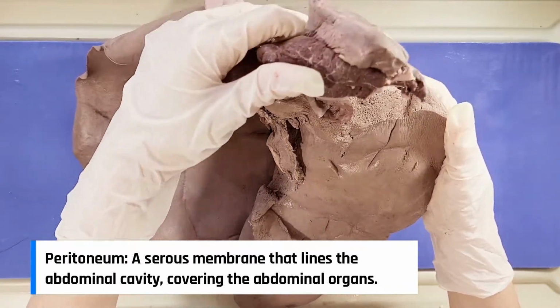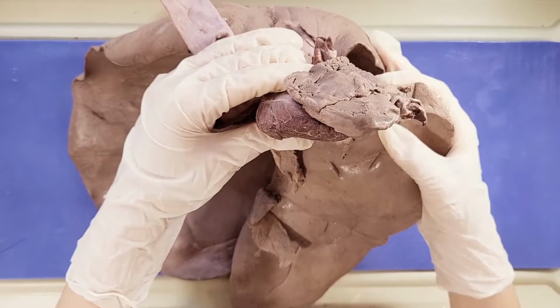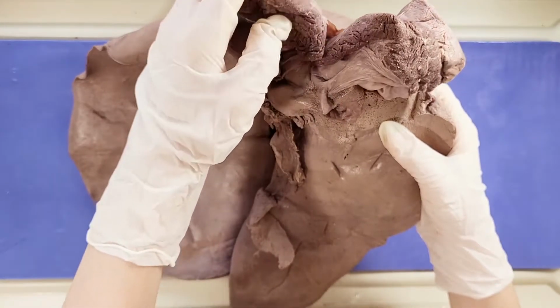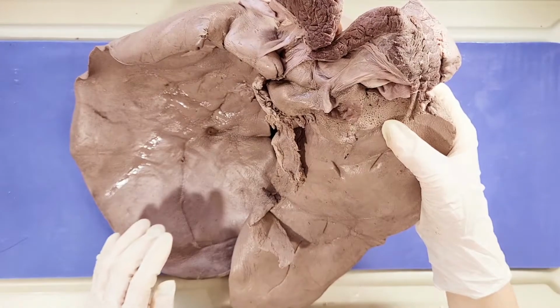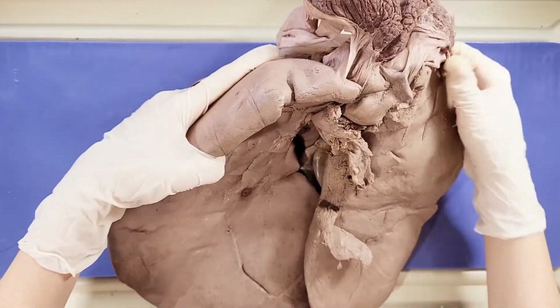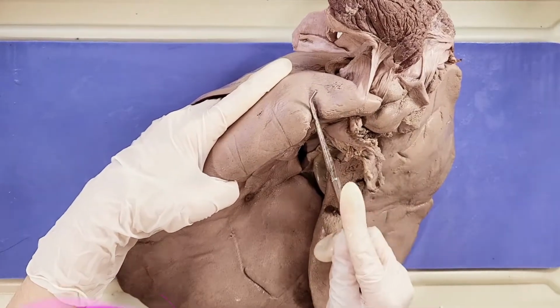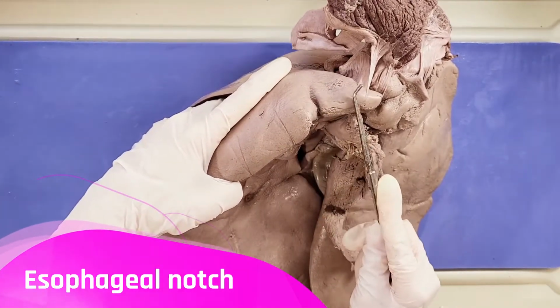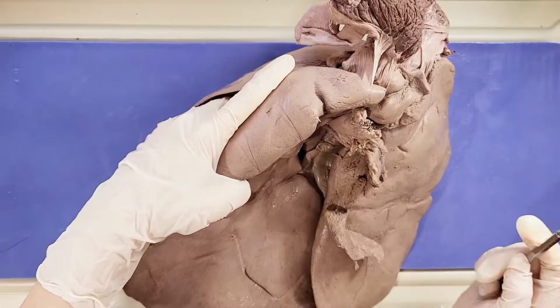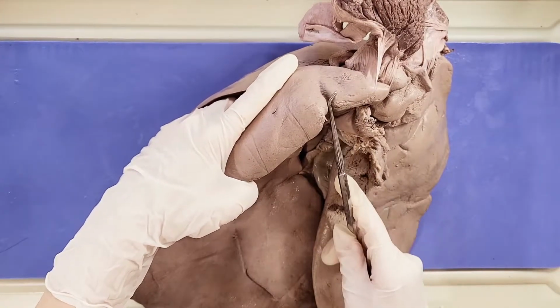The diaphragm here needs to cover almost the entire expanse of your torso in order to create negative pressure on the lungs when it contracts so that you can breathe. Because of this, when things need to pass between the diaphragm, there's usually a notch on the liver so that the diaphragm isn't too disturbed. So for example, you can see this slight dent here, and this is called the esophageal notch, and this is where the esophagus passes through. The stomach is located below the liver, so the esophagus passes through the diaphragm through this notch here and connects to the stomach below.